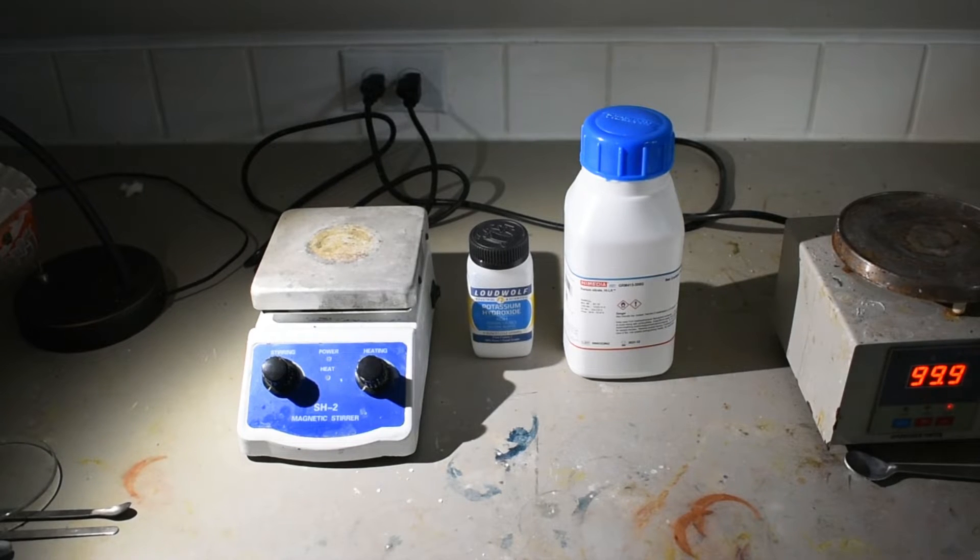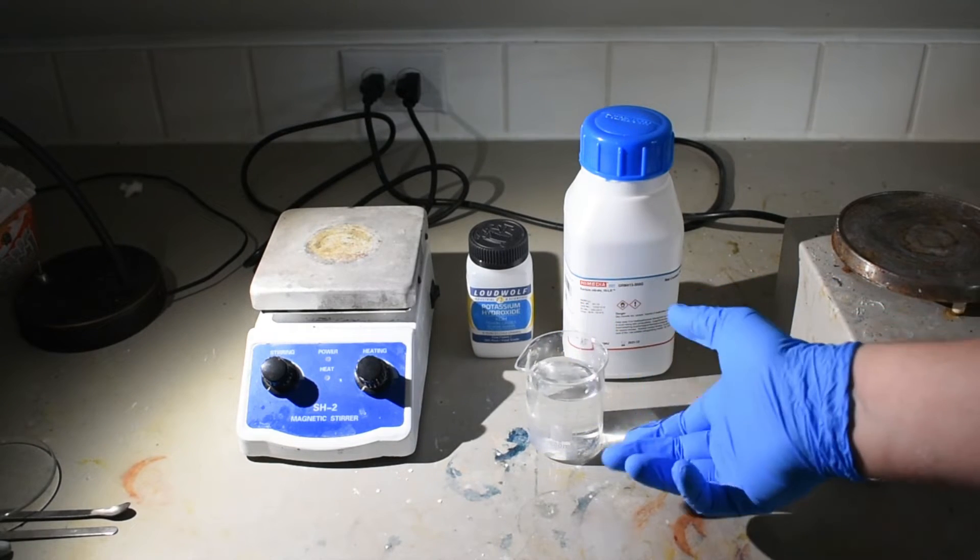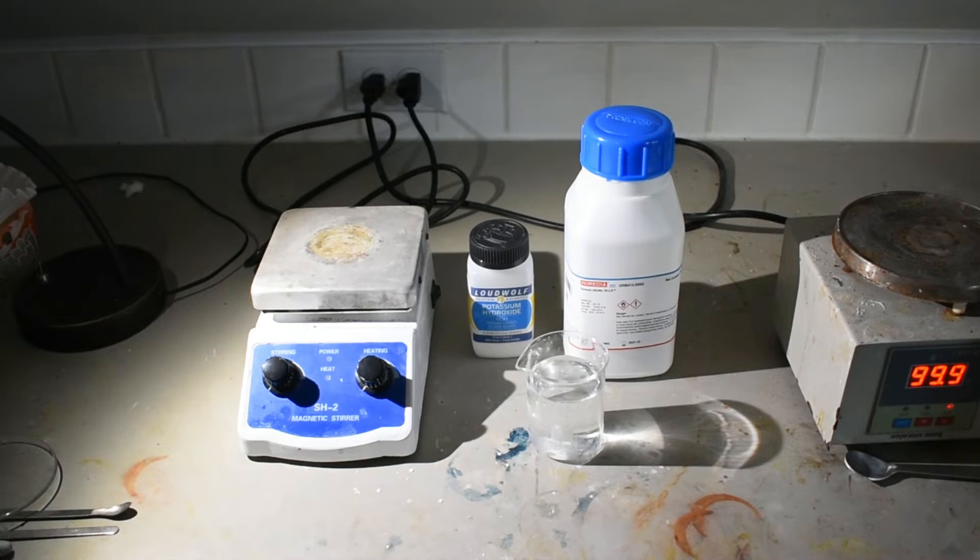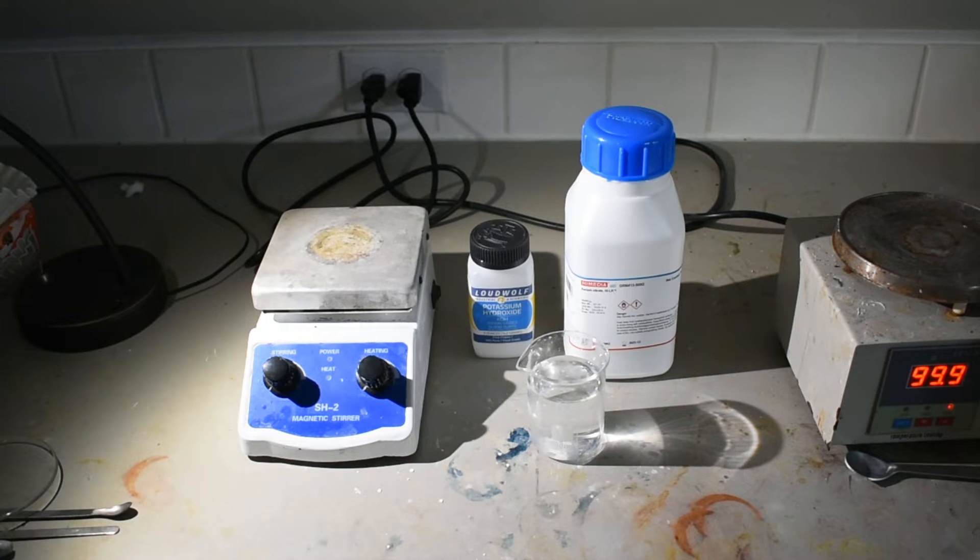You'll also need some concentrated hydrogen peroxide. Here I'm just using 35%, about 100 milliliters. Probably way more than I need, but whatever.